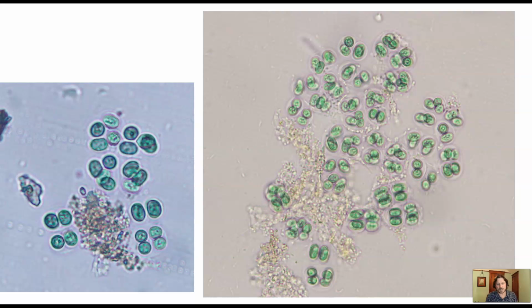So anyway, here you can see, obviously, the bright green are all the cells. And I would ask, how do you know this is bacterial and not plant cells? So we saw Elodea in the very first cell lab learning the microscope, and we saw little green dots of chloroplasts. And if we did our measurements, you'd see that these cyanobacteria, especially these Gleocapsa, are about the same size as the chloroplasts. Right?